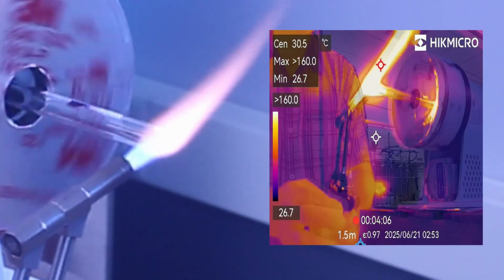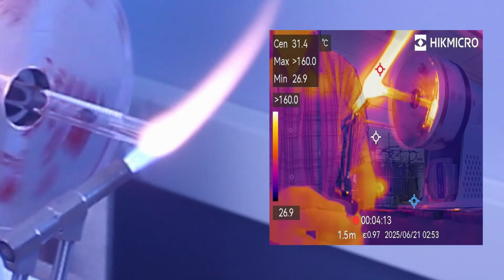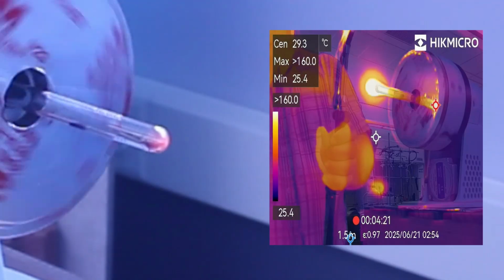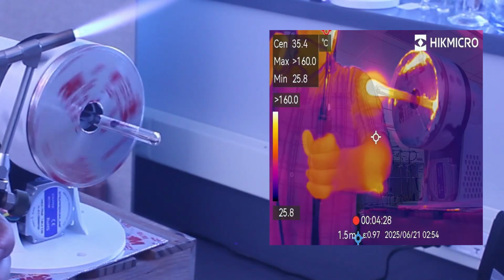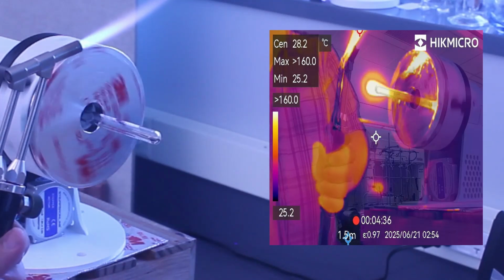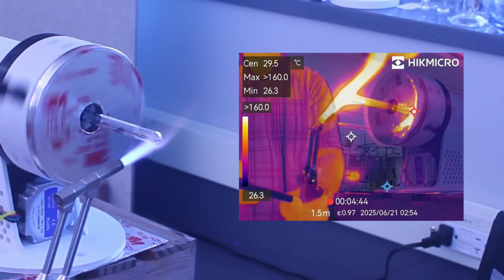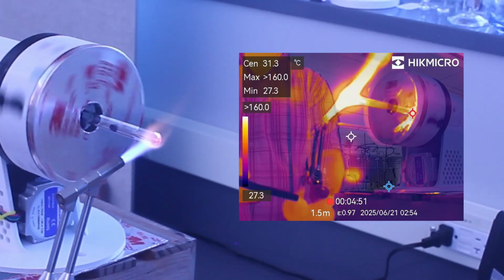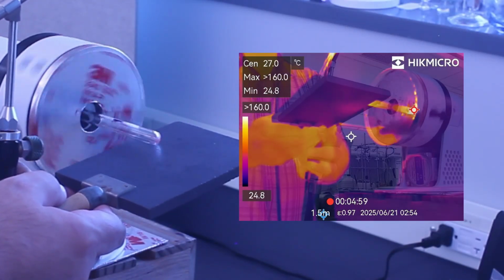So I'm going to heat this up. You see how it's gathering? That's me gently puffing into it to restore the shape. That's me dropping my blow hose. Another thing you can do, let's say you've puffed it out too much or you want to make some other kind of adjustments, you can bring in your graphite pad. Use that. I'm just going to warm this up again. It's getting molten. There we go.